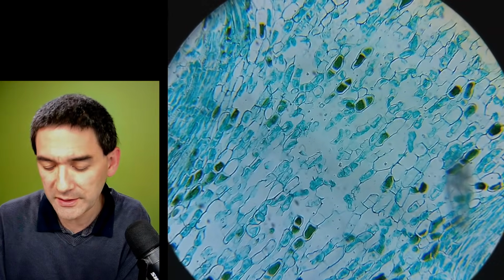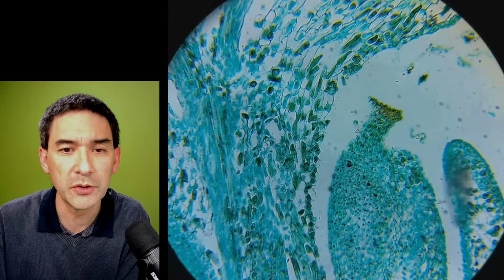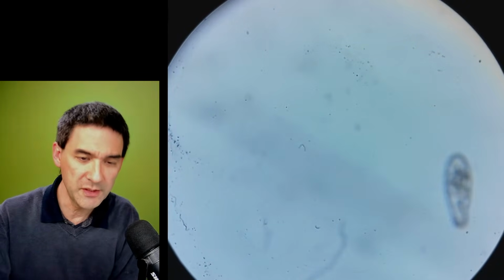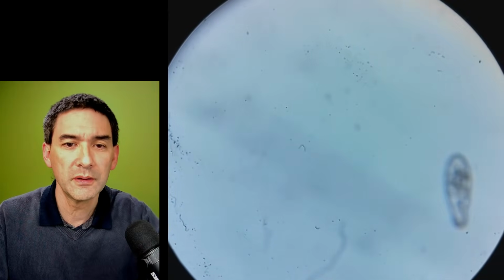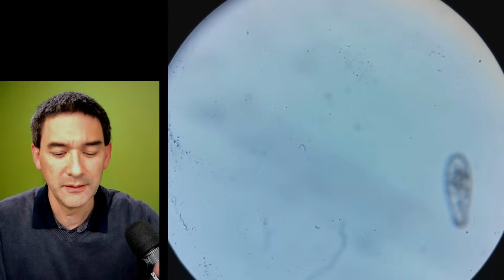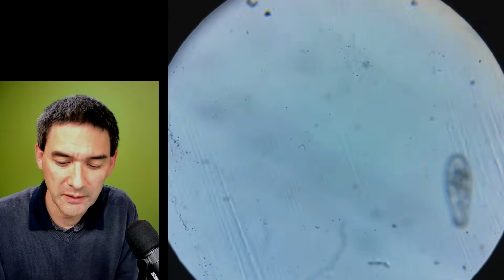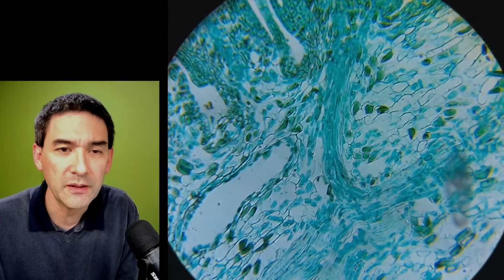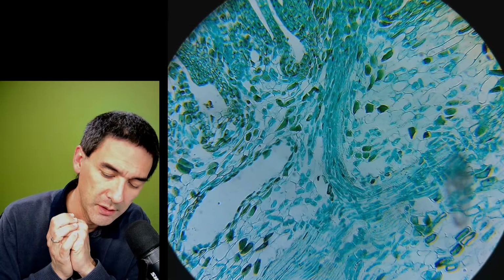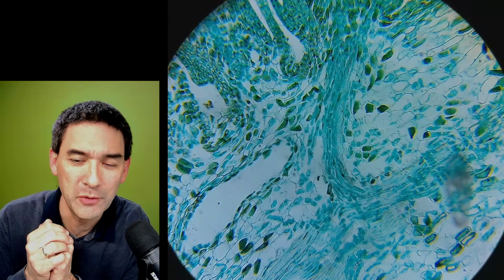By the way, this is a pine cone. And there seems to be a little bit of dirt somewhere. Look at this. What is this here? Looks like a paramecium. That's not a paramecium. There seems to be some dirt on the lens now. Unfortunately, but okay, I'm just going to ignore it. So I'm using another 10 times objective, and actually, considering the fact that it's a cheap introductory microscope, the image quality is quite fine.